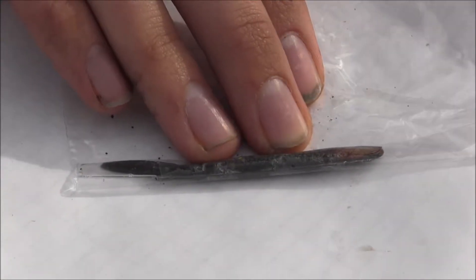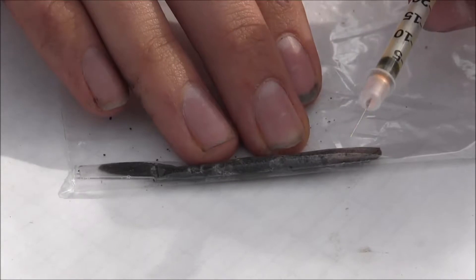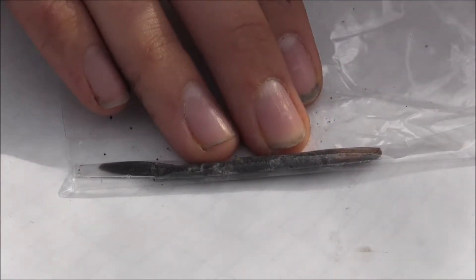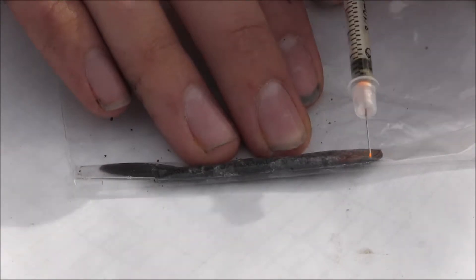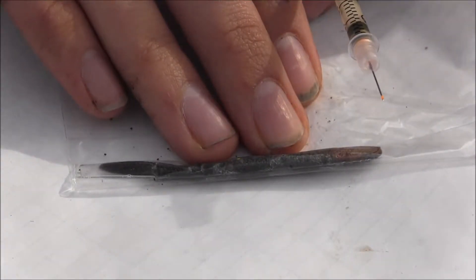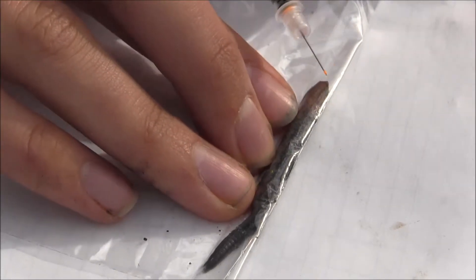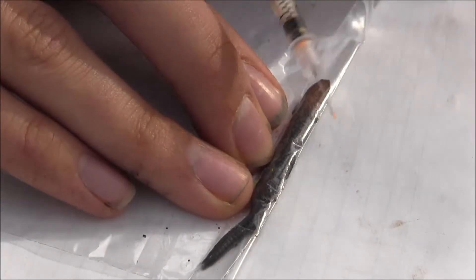I've got here my orange syringe. Once again, I'll get that bead of elastomer out on the tip. And so here, I'm going to inject in position two and position three.